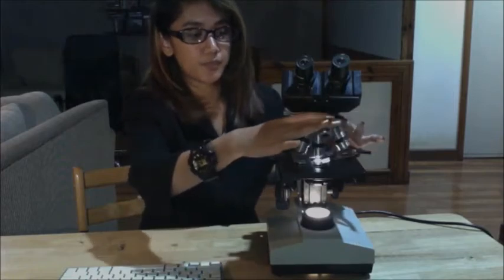For the second part of this instructional video, we are going to discuss the steps on how to use, adjust, and maintain a compound binocular microscope. So first, we have to turn on the microscope, and then as a general rule, always use the lowest power objective lens, which is your scanning objective, in order to find your specimen first. On the microscope in front of you, this is the 4x lens that is colored red. So now, let us turn this objective into place.